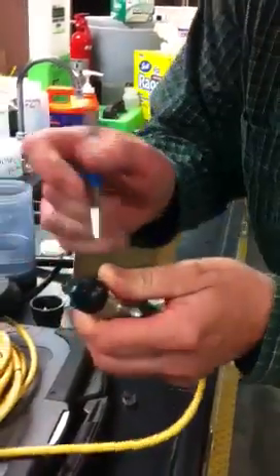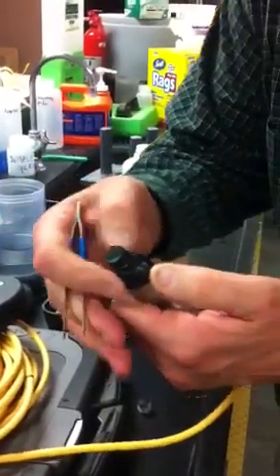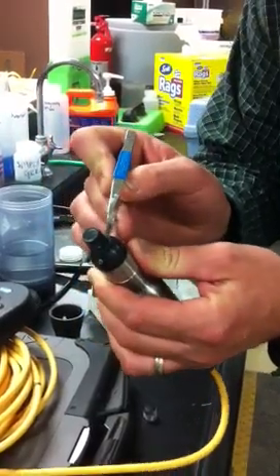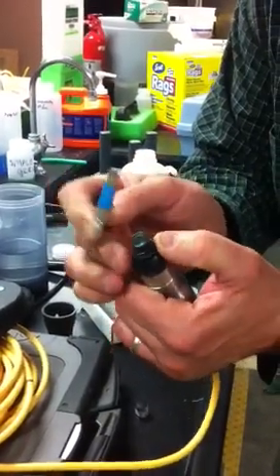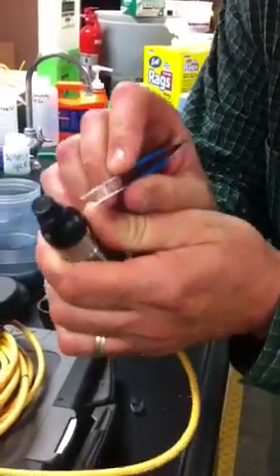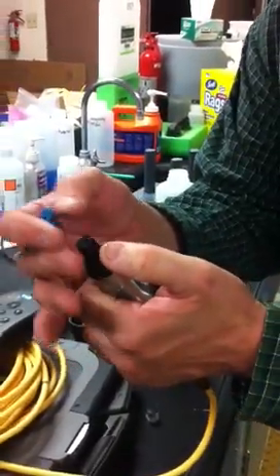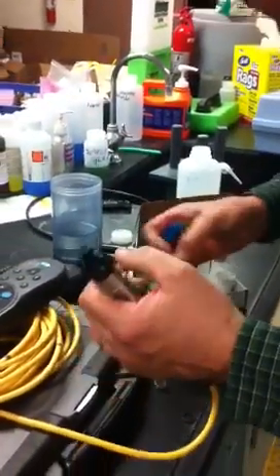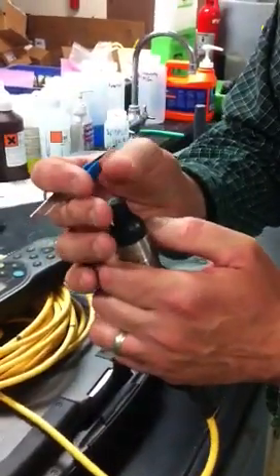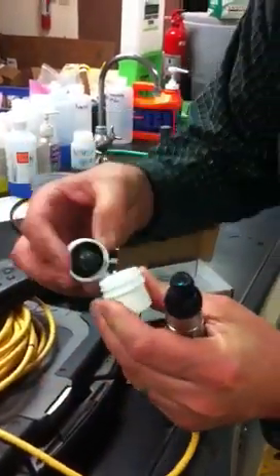There, just like that. Underneath here, there's a little tiny seal, and it comes off the same way. Use a little forceps or a small pocket knife would work without scratching any of the metal. And the key is that there's a thin part and a thick part, and you want to put the new one on the same way. Put the thin piece up and the fat piece down. Put it on about halfway, and then you use the new cap to thread it on.